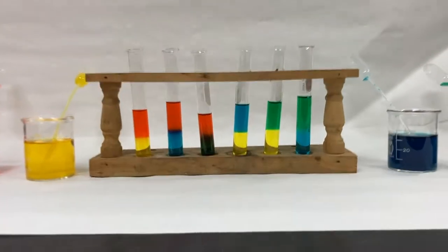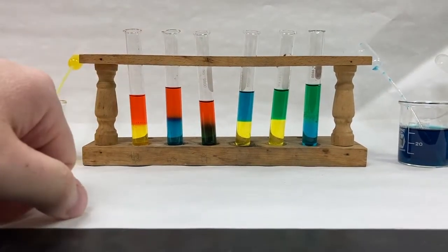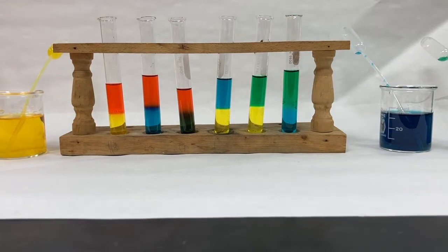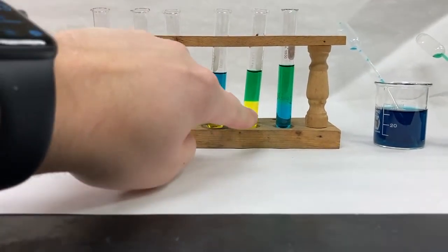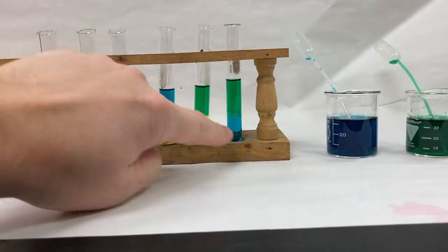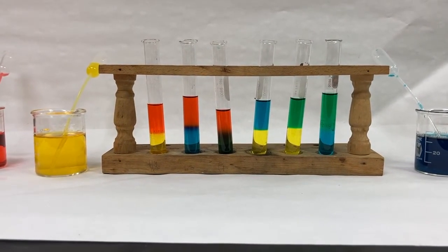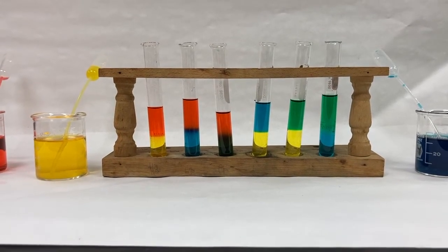All right, so just a quick summary. You can see that we have red with the other 3 colors in the first 3 test tubes. Then we have yellow with the remaining 2 colors that yellow hasn't been tested. Remember, yellow was tested with red over here. So yellow only had 2 more colors to be tested with. And then blue and green in our last test. So make sure, looking at these, make sure your data table is checked off. Not checked off, but you have the colors written in and you say which color is on top, which color is on the bottom.